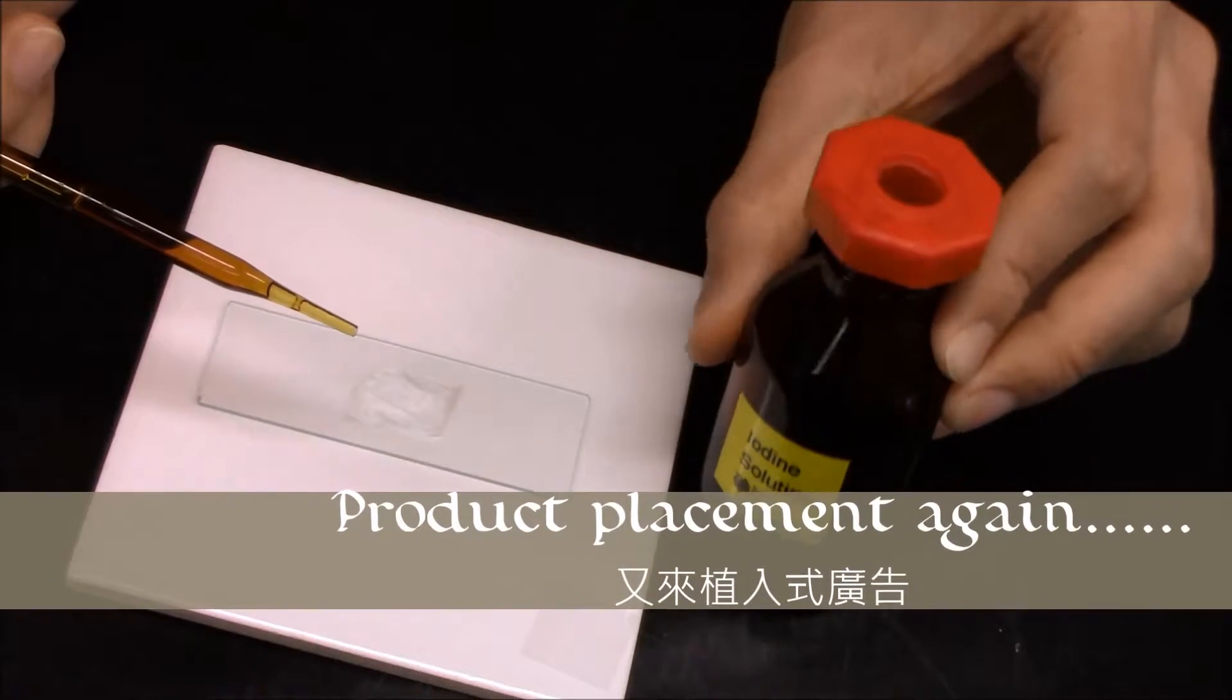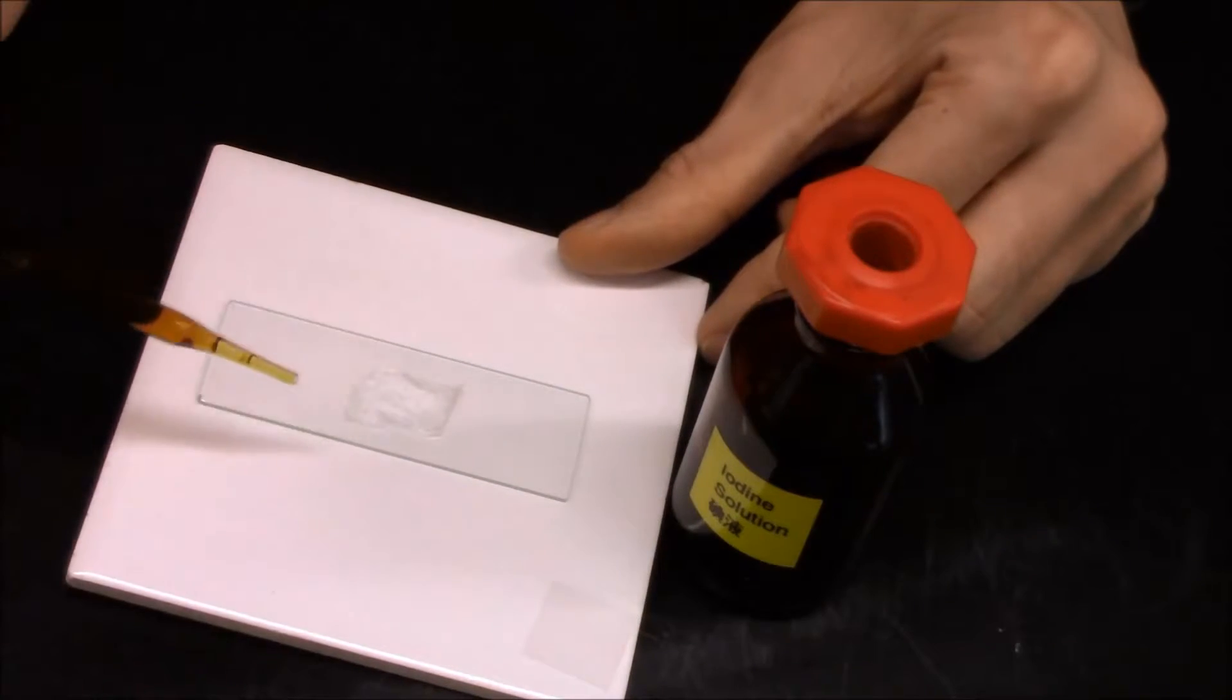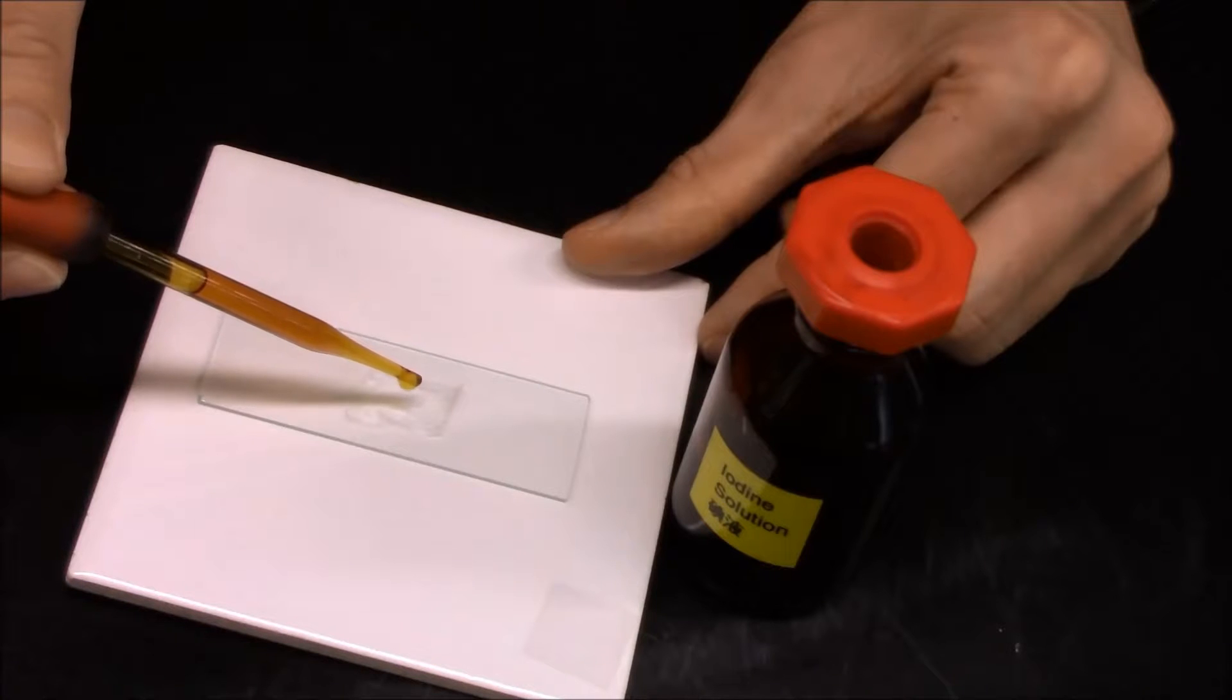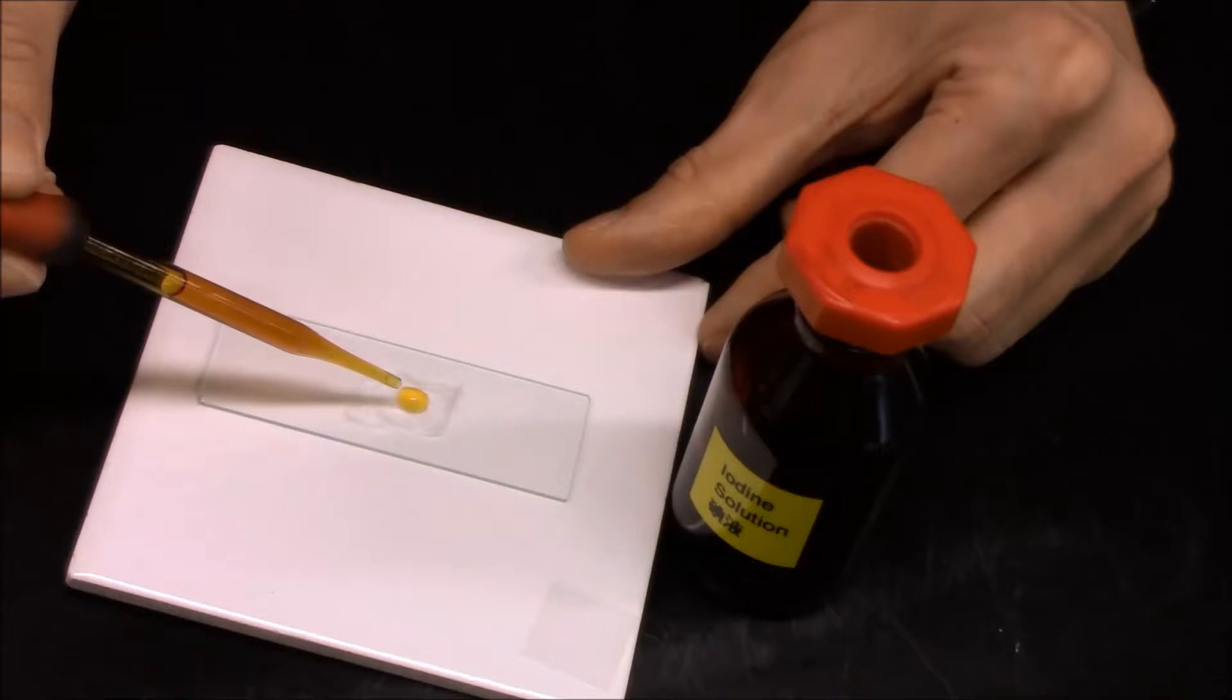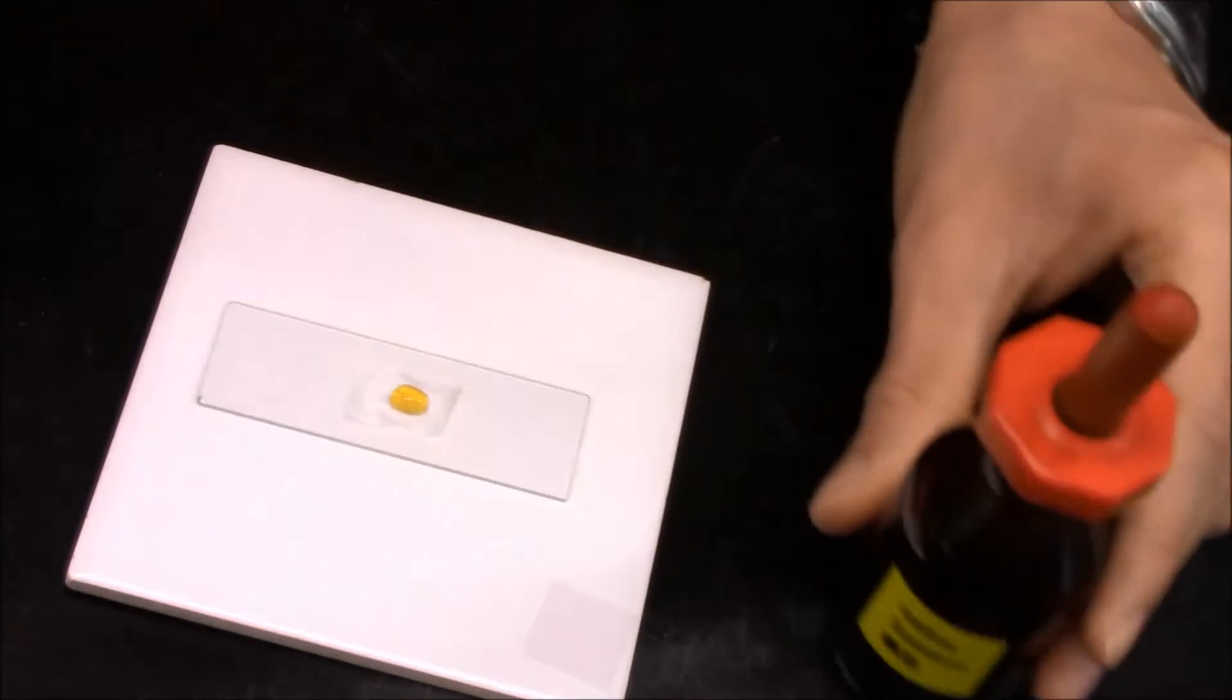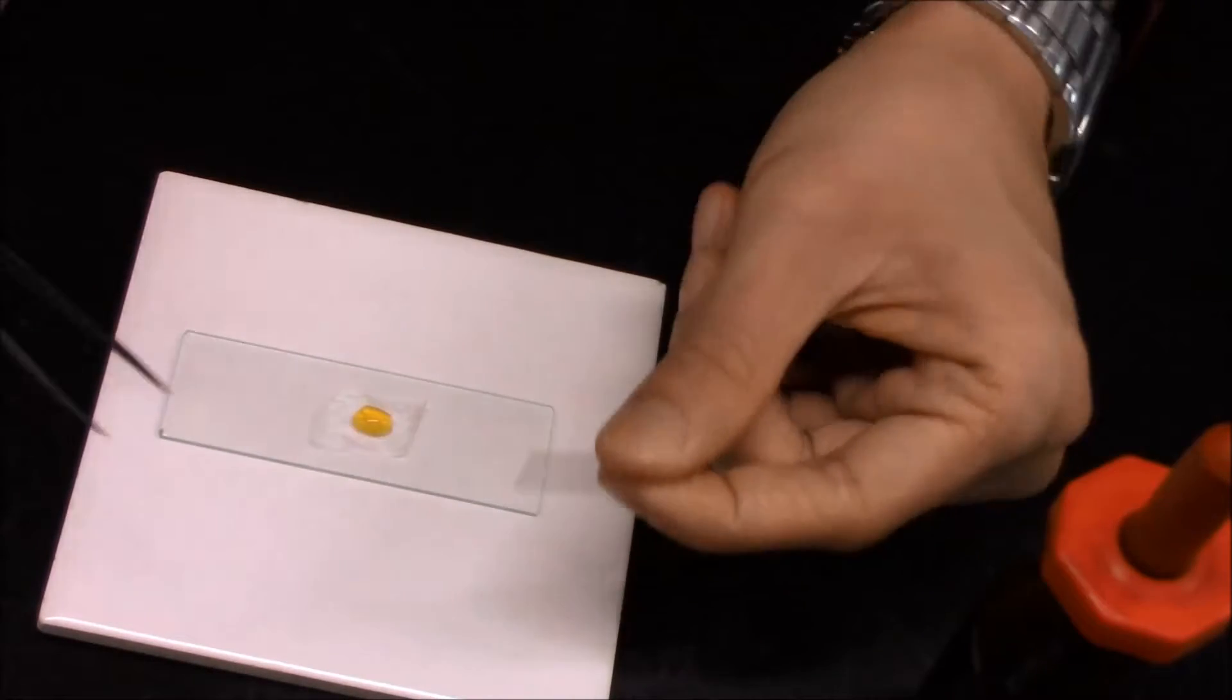Beware of your finger. Don't add too much iodine solution, maybe just one drop. One drop is okay, so I add one more. So probably we add it, and then what we need to add and put on that is the cover slip.